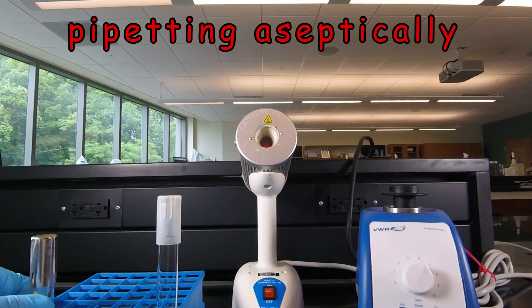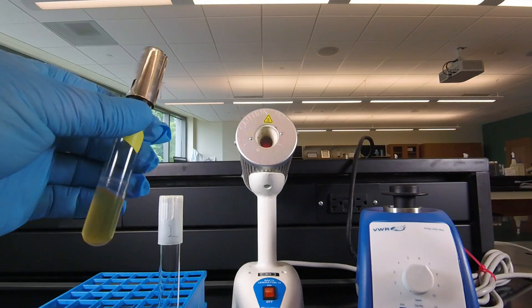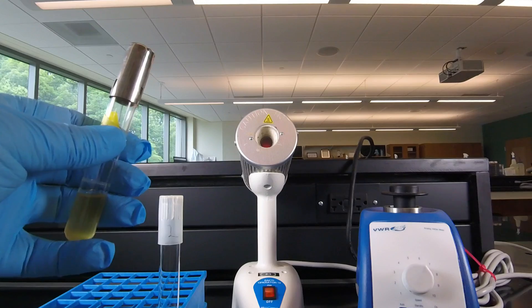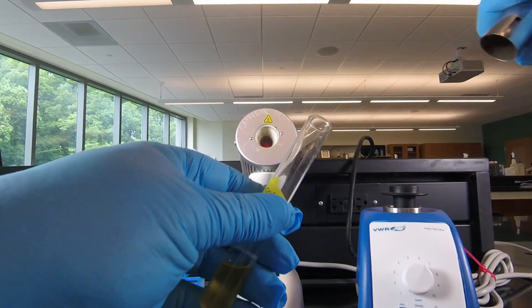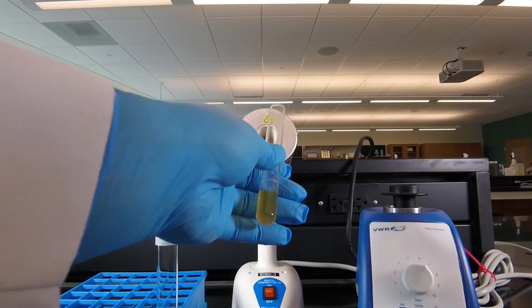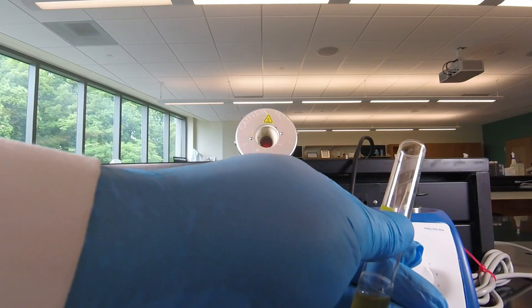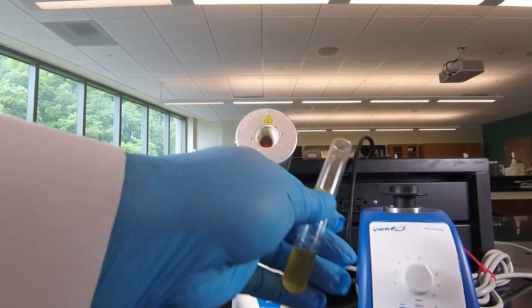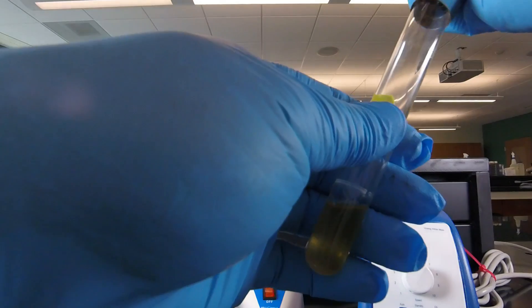...is that one person be responsible for handling the tubes and doing the aseptic technique part of that: removing the cap, flaming the tube, handing it to the person doing the pipetting after they remove the bacteria, flaming the tube, putting the cap back on.